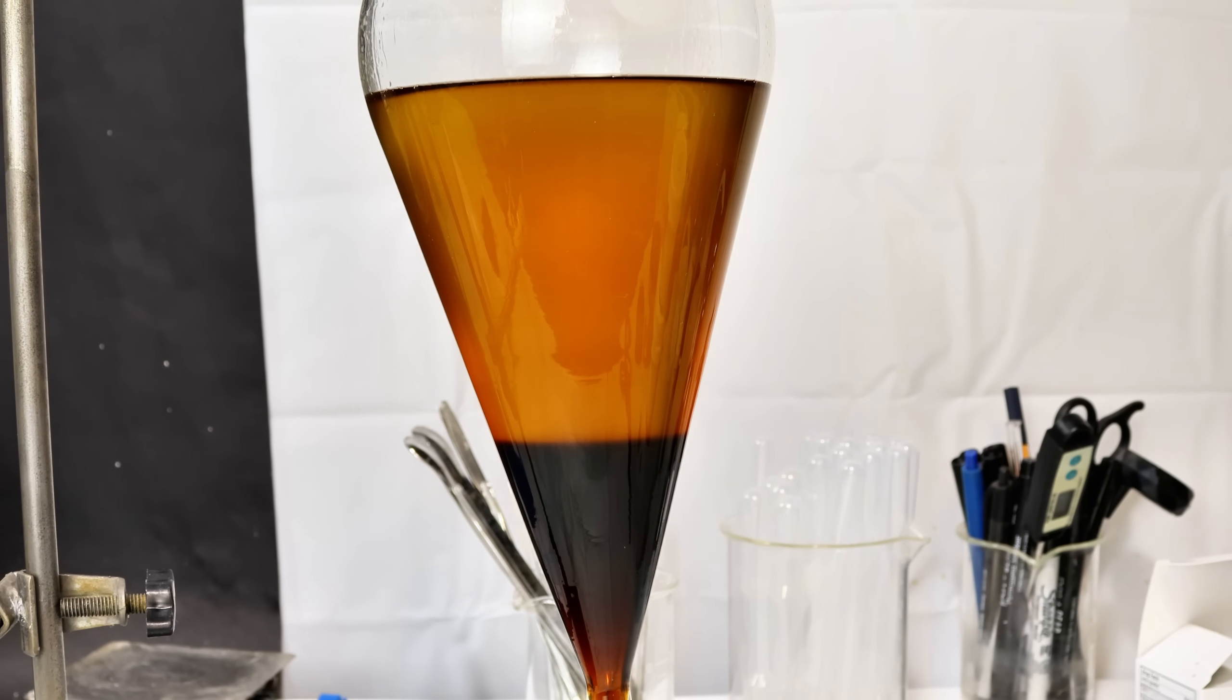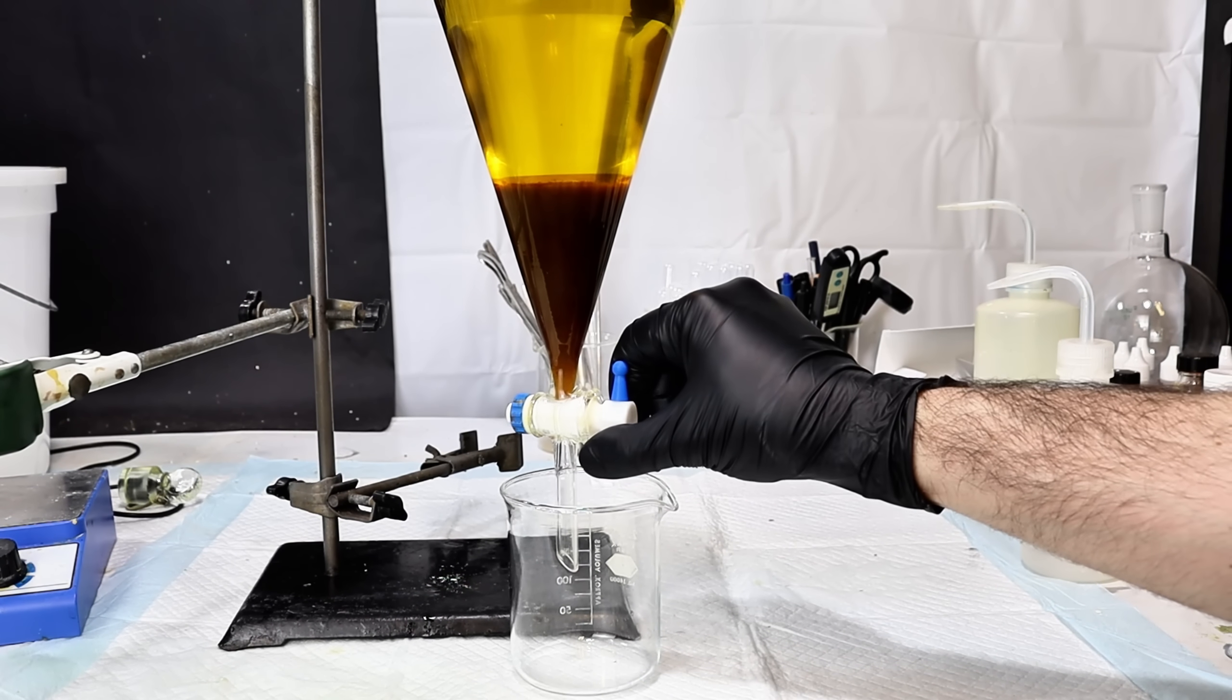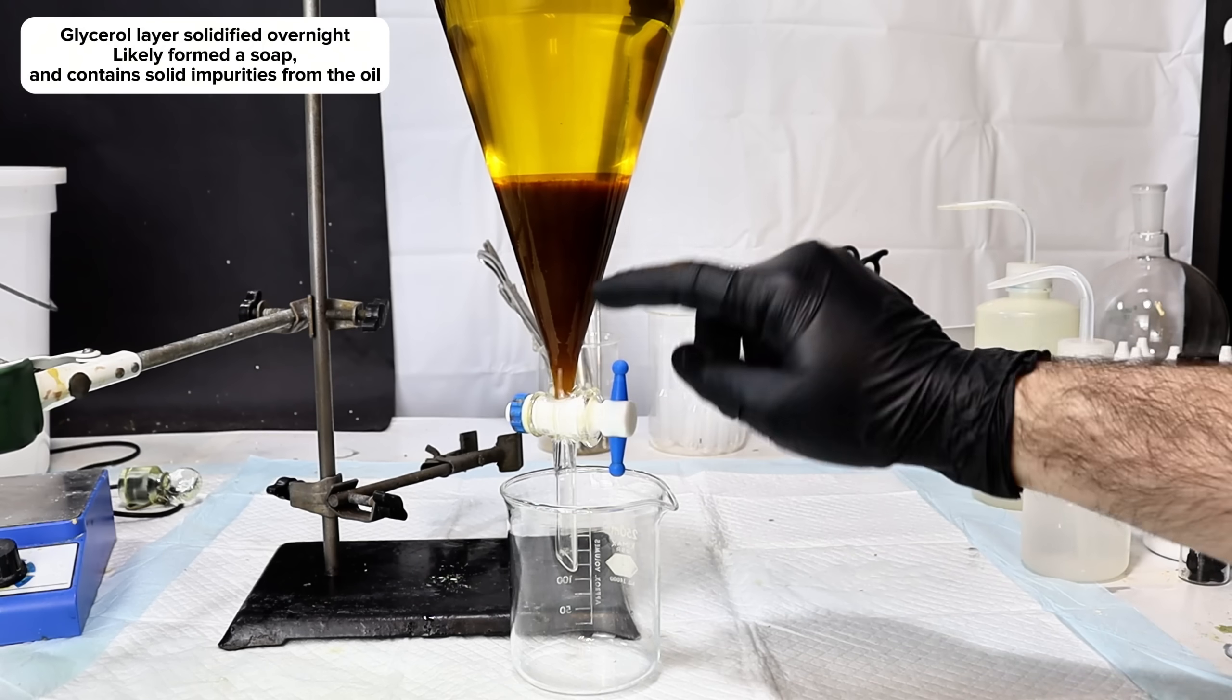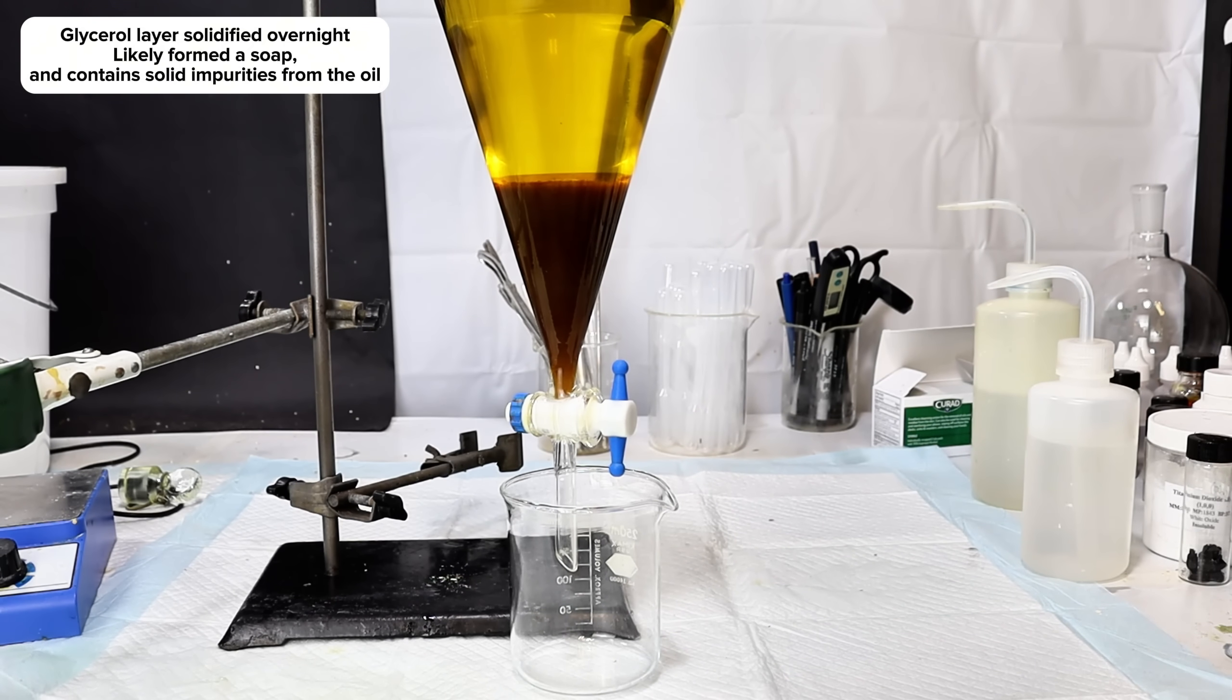When I came back the next day, my plan was to drain away the glycerol layer so that I could begin the process of cleaning up the crude biodiesel. Unfortunately, I quickly found that the glycerol had solidified, and that wasn't going to happen.